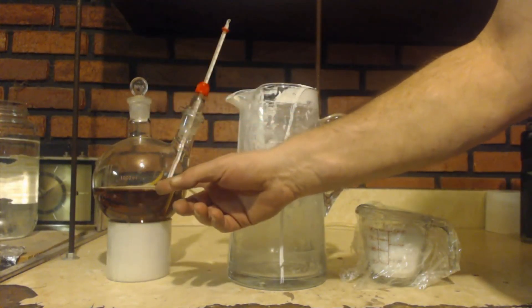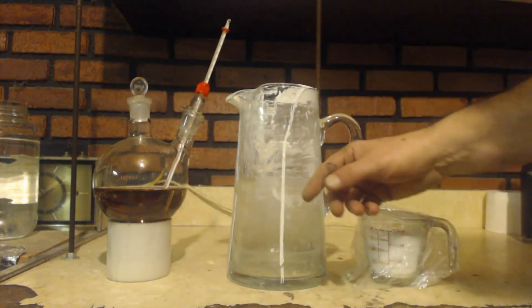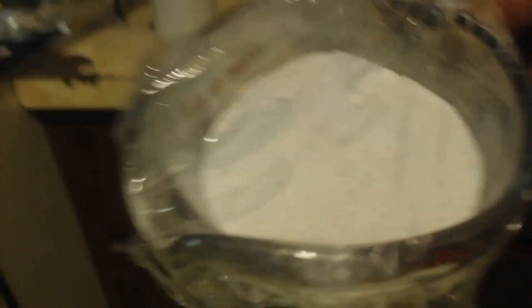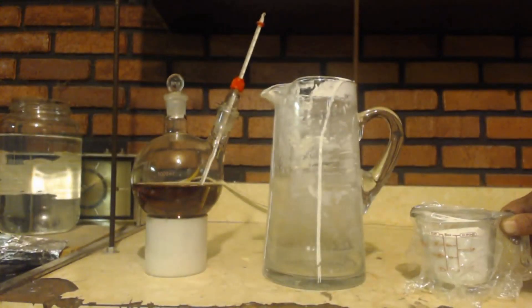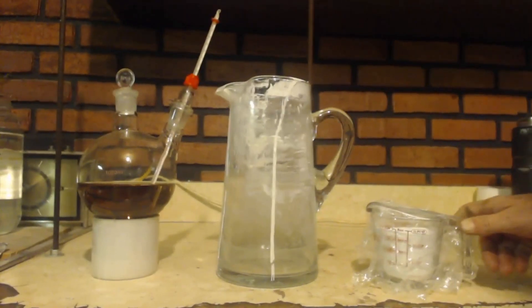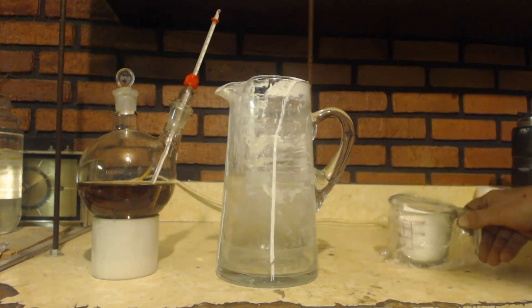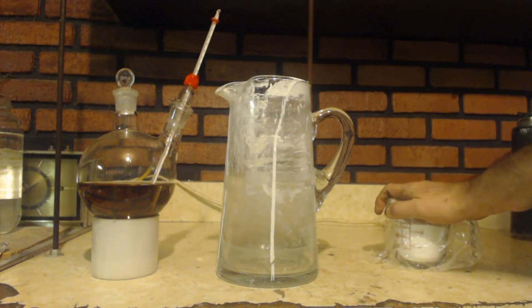Here are my products — the pot, an empty container, and some calcium hydroxide-calcium carbonate mix. It's totally white, totally good. Since it's a mix, it's hard to say exactly, but it's about a mole and a half of calcium base.